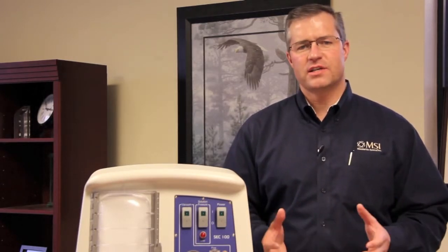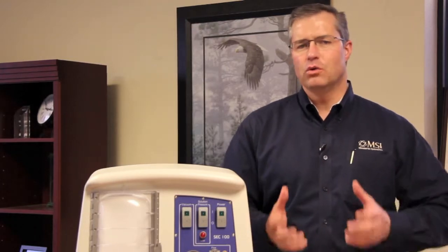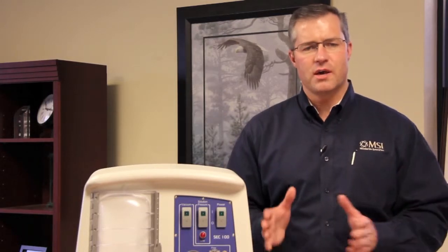Hi, I'm Jared with MVAC Systems. Today we're going to talk about the MVAC System, its different components and how to set it up properly. You will probably notice that I'm not wearing any kind of protective equipment. The primary reason for that is because there are so many different protocols and methods of doing it, different choices of equipment — we've chosen just to show you the MVAC System and not worry about that part.